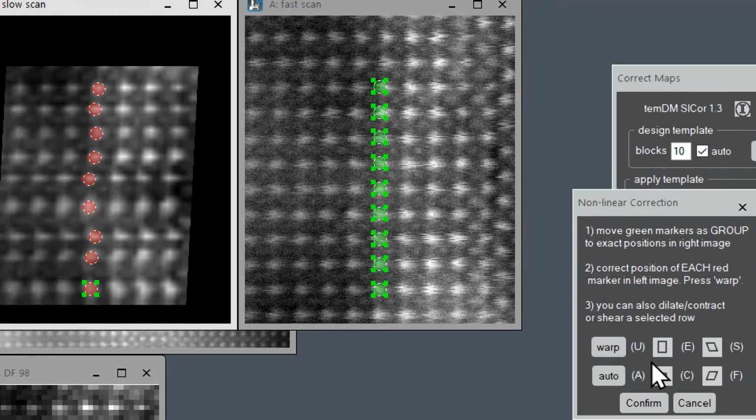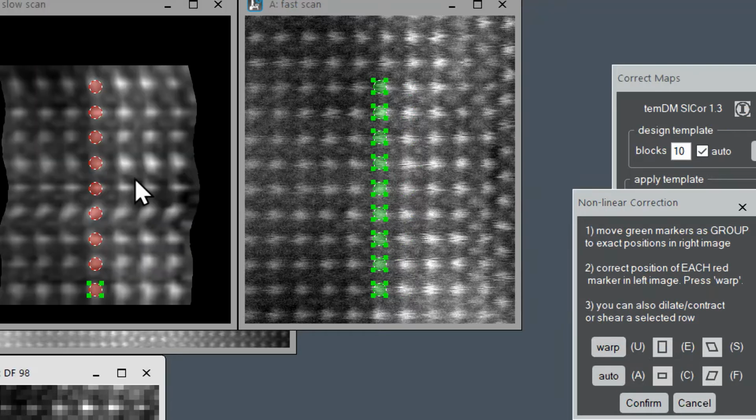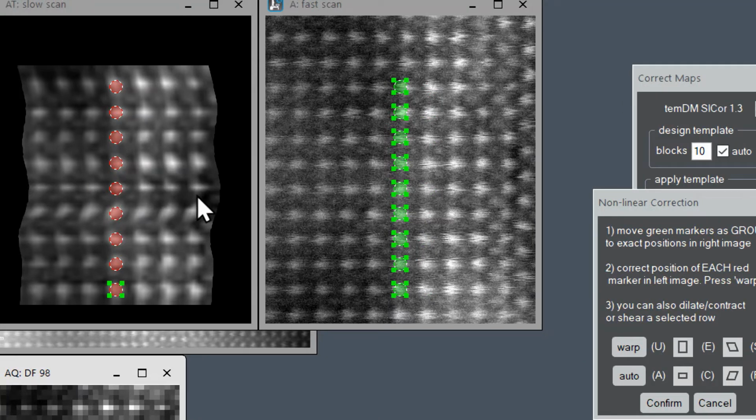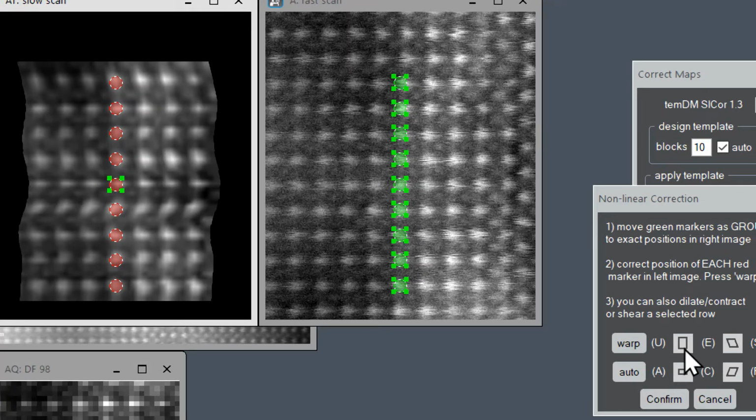Okay, now click the button warp. And you see that the arrangement of atoms is already improved. But there are still a couple of issues. For instance, look at that row. It is weirdly contracted. That's because during scanning there was some sudden vertical drift of the sample. So let's select the corresponding marker and press the button expand. Now it looks much better.